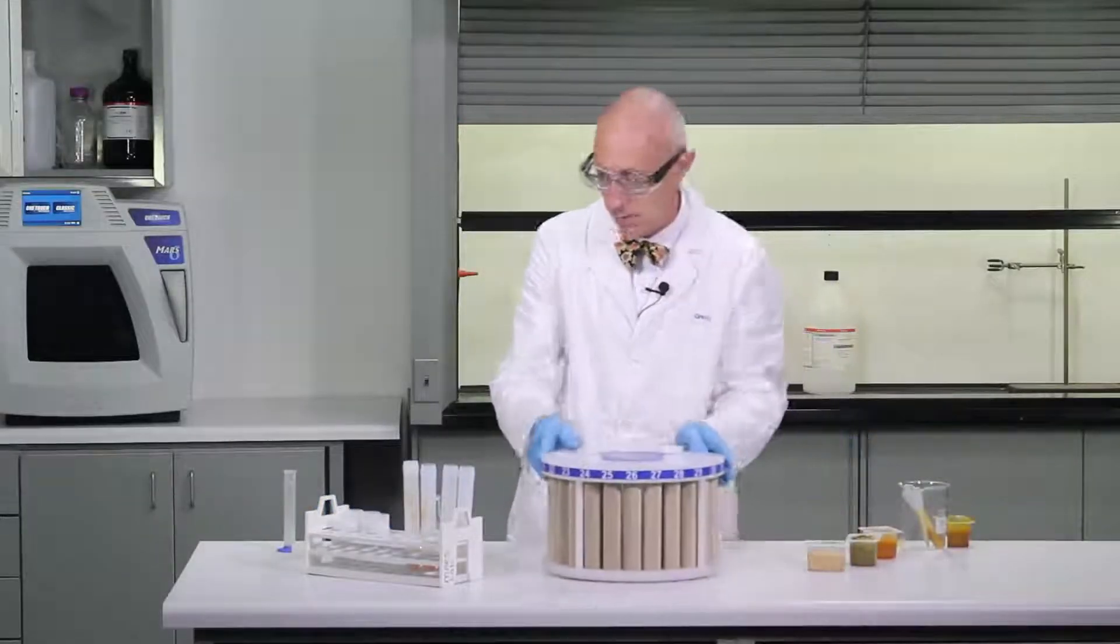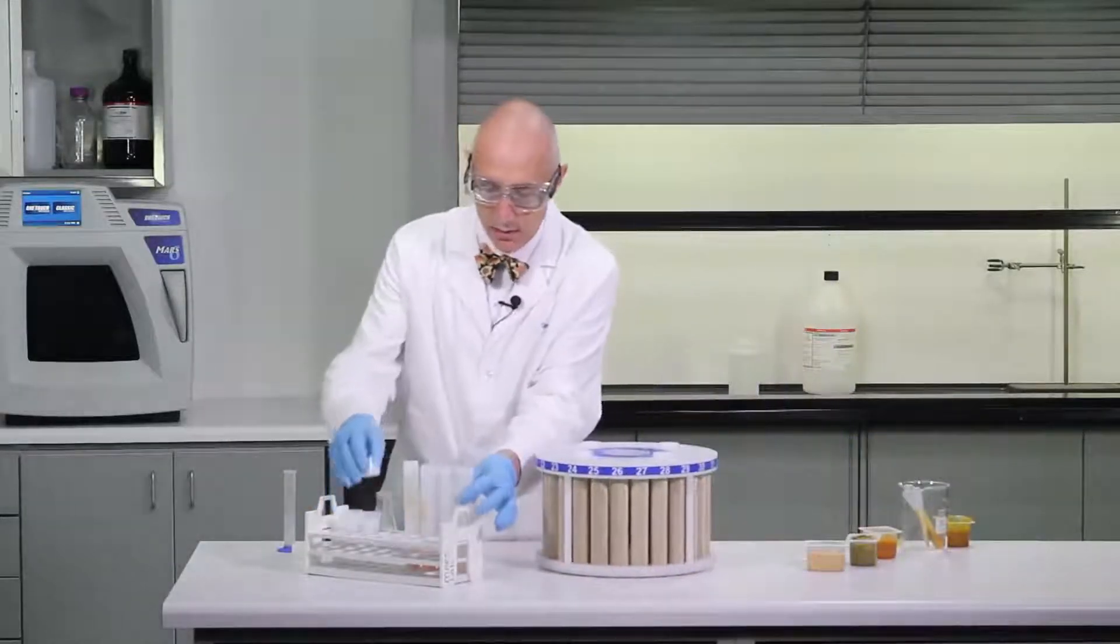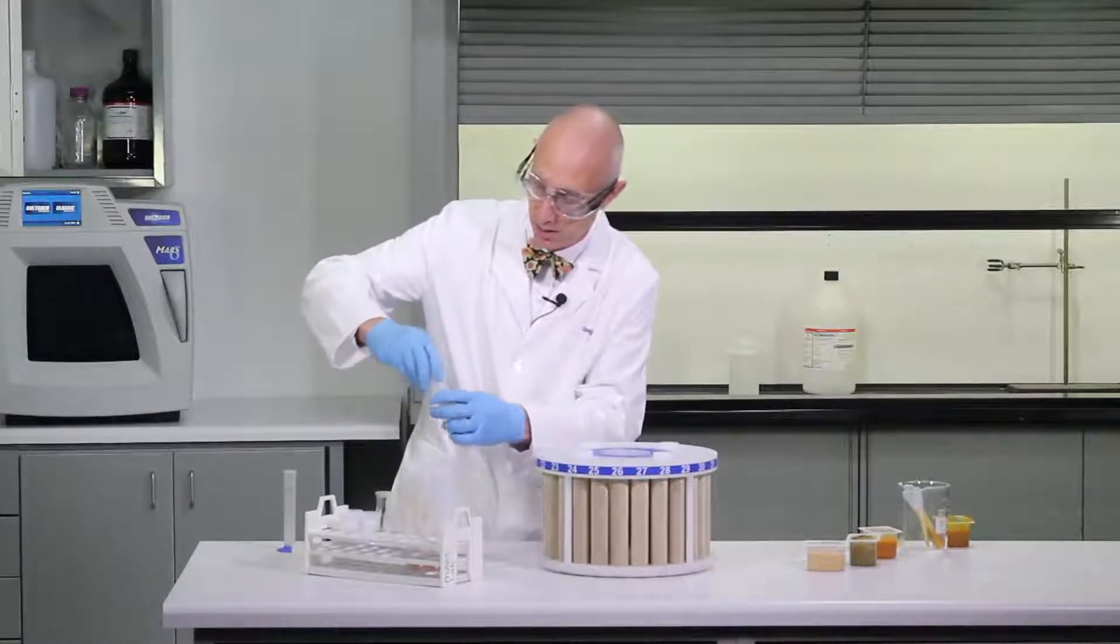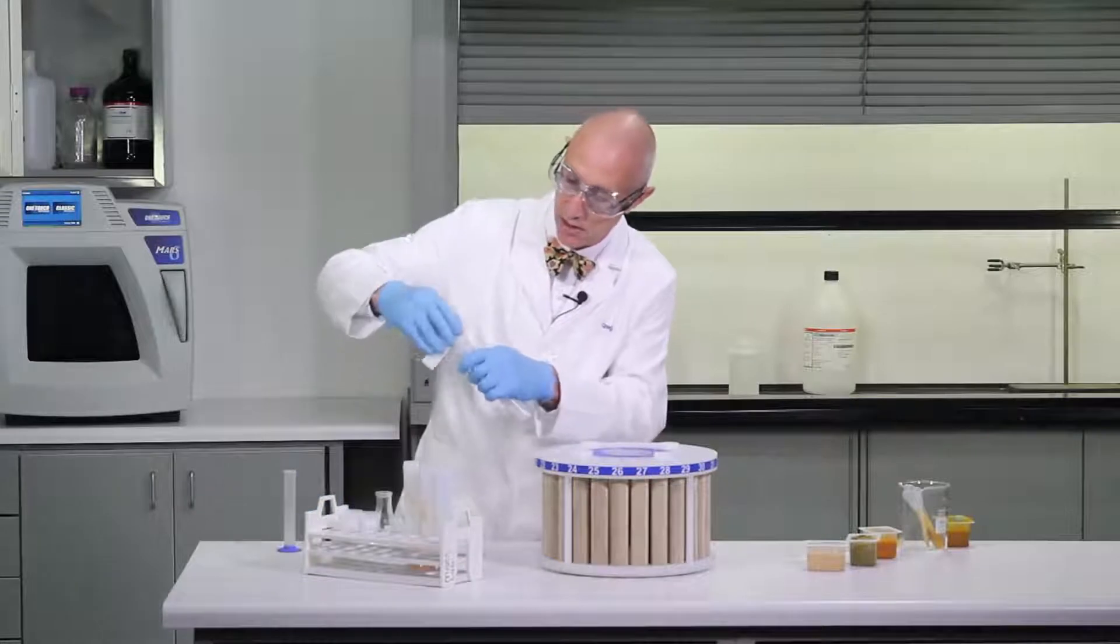Now that we've got all our samples weighed out, let's cap them off, place them into the turntable, and then we'll head over to the microwave to start the digestion process.